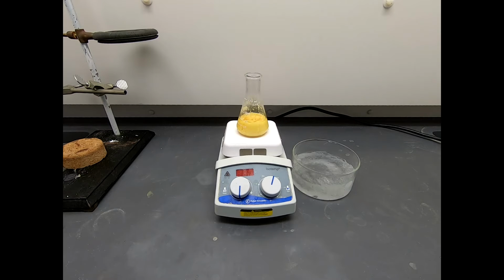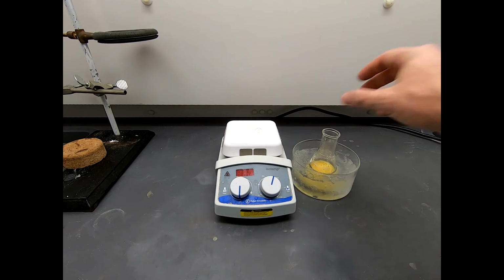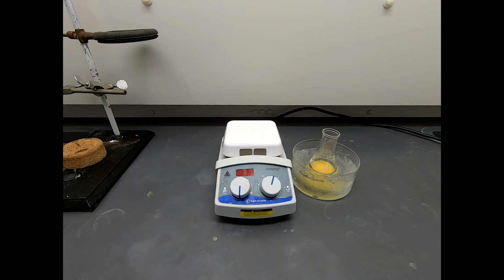So what we're going to do is we're going to take this. There could be some solubility of the product in that liquid. So to minimize that, we won't be able to completely eliminate it, but to minimize it, let's put it on ice and let that cool. And we'll let that cool for maybe 30 minutes, and then we'll be ready to do a suction filtration using a Buchner funnel. And we'll need a pretty good sized Buchner funnel, because that's a pretty good amount of product. So that's what's coming up, a Buchner funnel filtration.